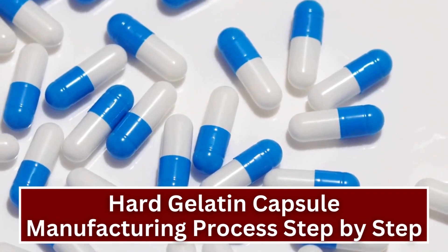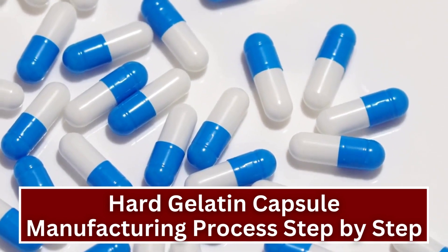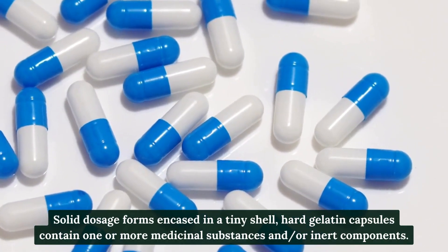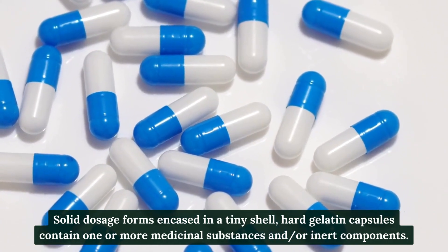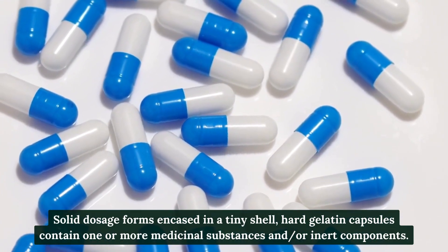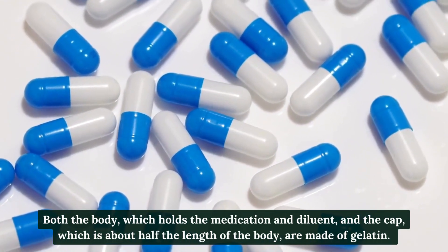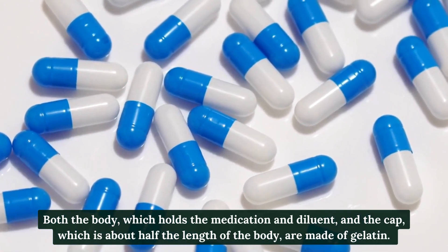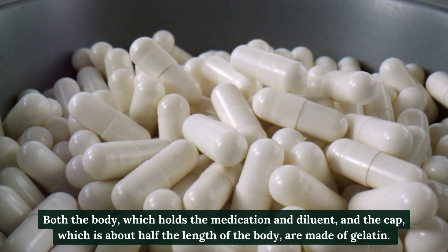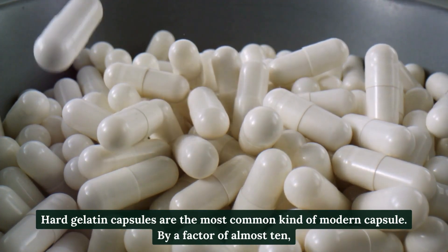Hard gelatin capsule manufacturing process — step by step. Solid dosage forms encased in a tiny shell, hard gelatin capsules contain one or more medicinal substances and/or inert components. Both the body, which holds the medication and diluent, and the cap, which is about half the length of the body, are made of gelatin.